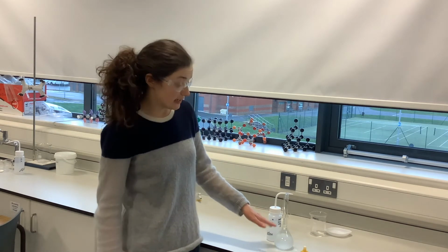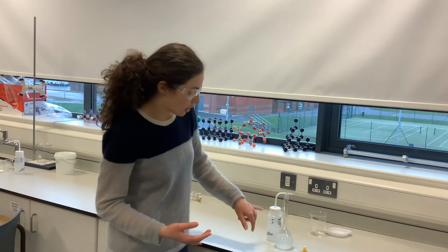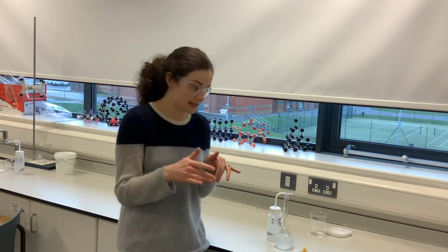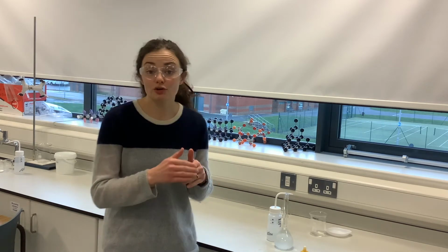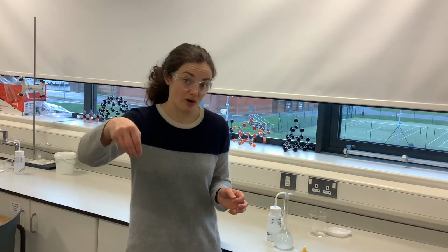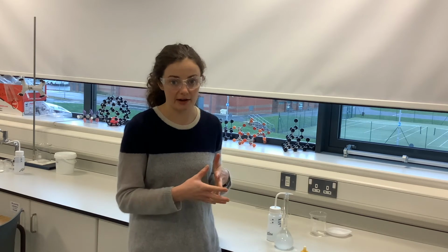Once you then get to the neck of the volumetric flask, you need to start being a little bit more careful and adding a bit more slowly, because what we want to do is make sure the bottom of our meniscus of our water level is on that line. When it's on the line, we know that we've made up our solution to 250 centimetres cubed. As I mentioned before in a previous video, if you go slightly over that, you have to start again, because it's not like we can just take a little bit out, because that little bit we've taken out will contain some of our dissolved salt, so we cannot do that. So we add drop-wise towards that mark, so we've got to be really careful at this point.